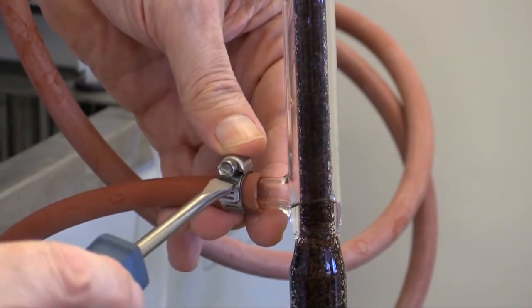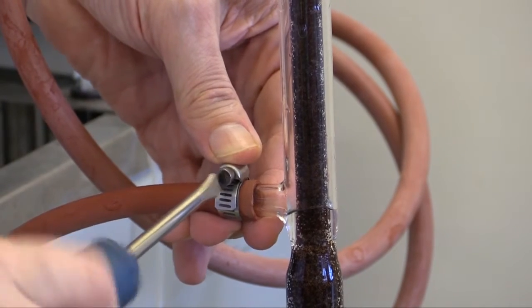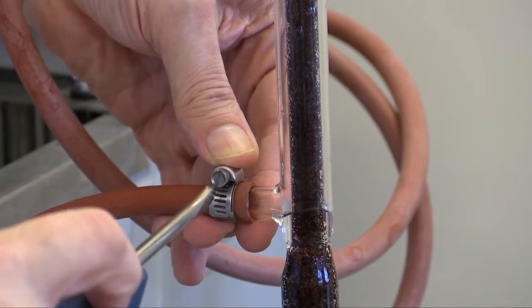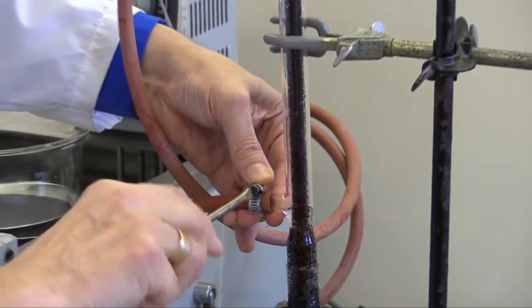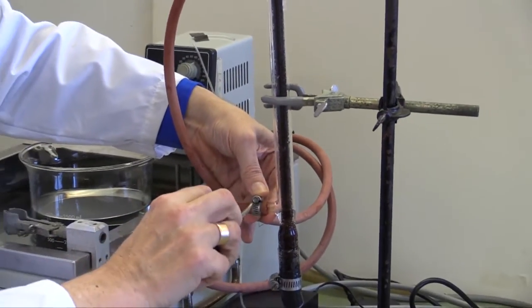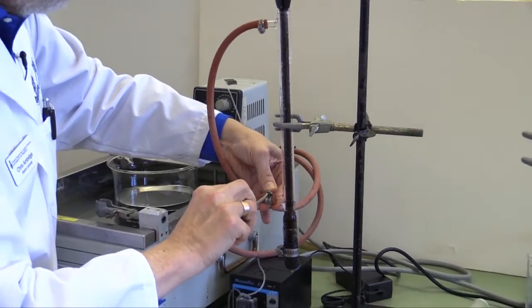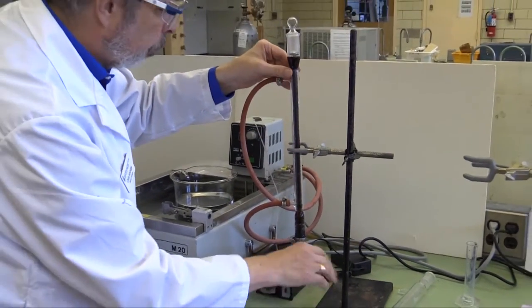Using a simple slot screwdriver you tighten this up. And this will hold the tube in place much more firmly. And there's one down here to do with the feed one. And tighten the hose clamp again. You don't need to have it horrendously tight, just until it's firm, and that's probably good enough.